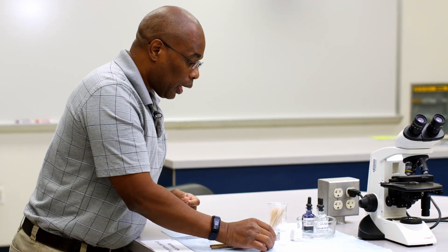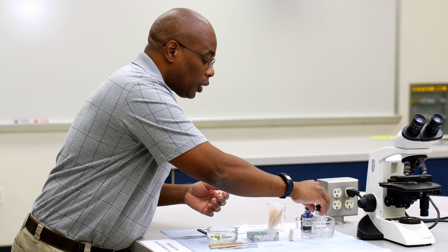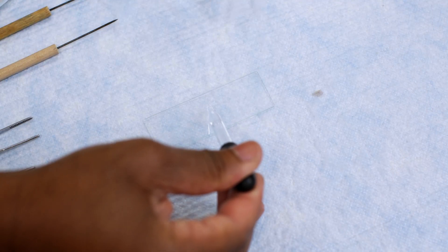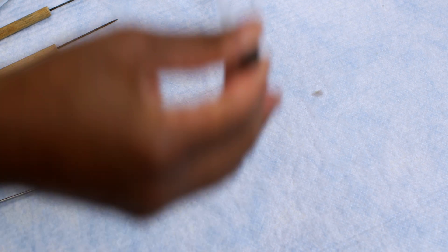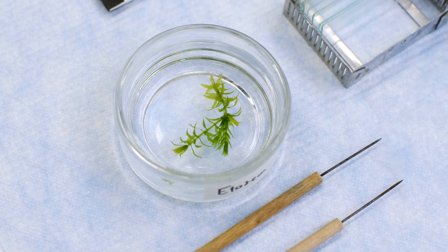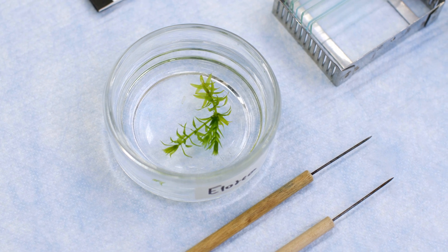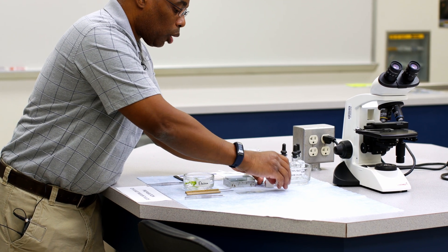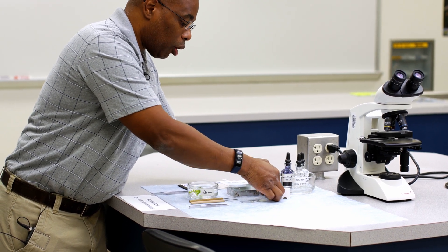The first thing we're going to do is take a microscope slide and add just a few drops of distilled water. Next, we're going to take our plant cell — I'm going to pick just a leaf from the plant itself. Then I'm going to place it in the distilled water. Lastly, we want to protect our sample, so we're going to put a cover slip over the sample.